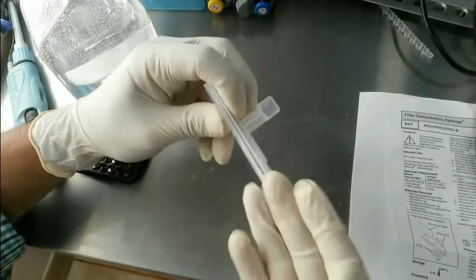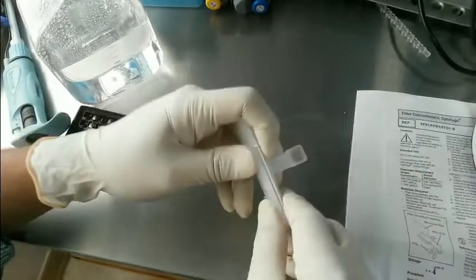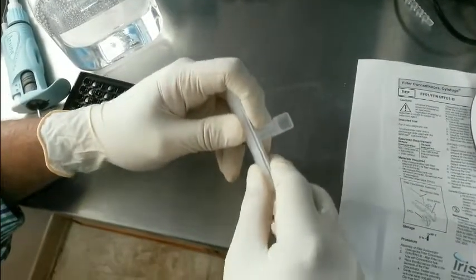So here your slide is ready to fit in the centrifuge.